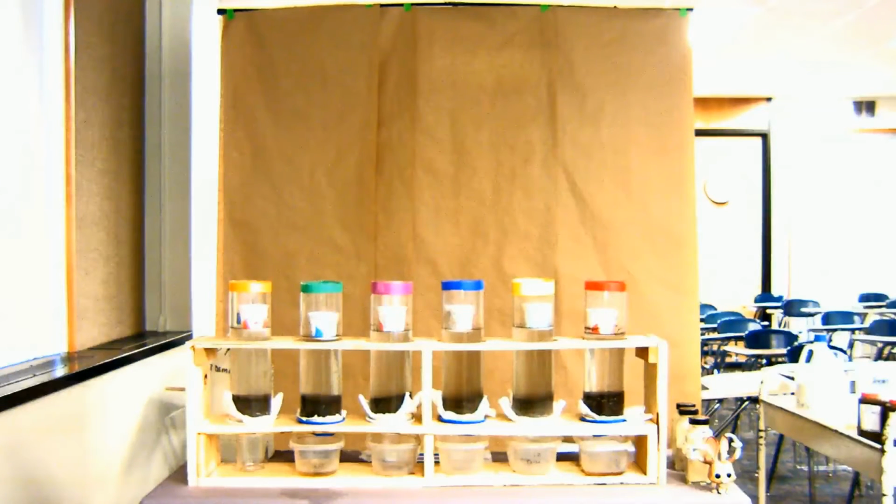But you can already see the green one's already moving down, and then the red one is starting to move down as well. The reason, of course, is that you have high electrical conductivity with both of those, which is basically controlling the diffuse double layer, the flocculation, so your water's moving through just fine, and the fact that you have an exceptionally coarse textured soil on the red one. Okay, so we'll go back and forth to that as we move.